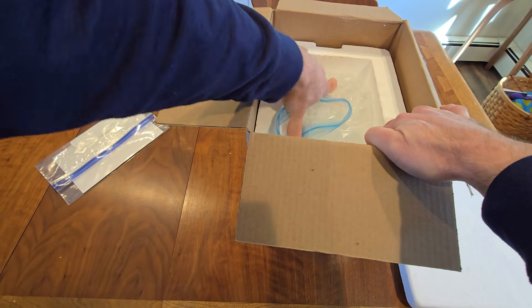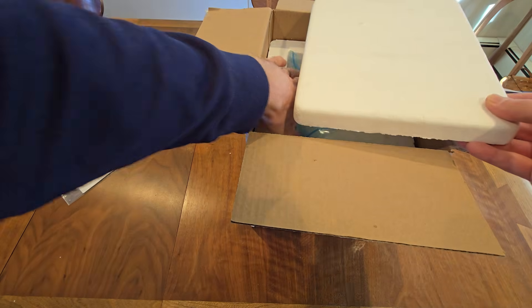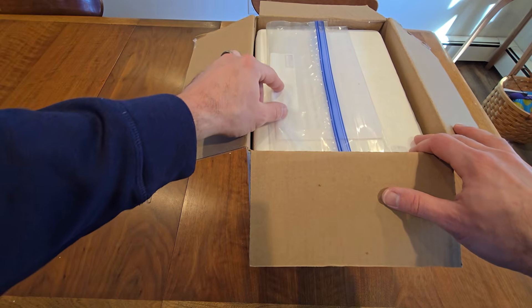The two bags of ice should be taking up the entire space of the cooler with very little air space. If you have room for more ice, open up the second bag of ice, add more, and reseal the bag. You can now put the lid on the cooler, place the bagged lab slip on top, and close up the shipping box.